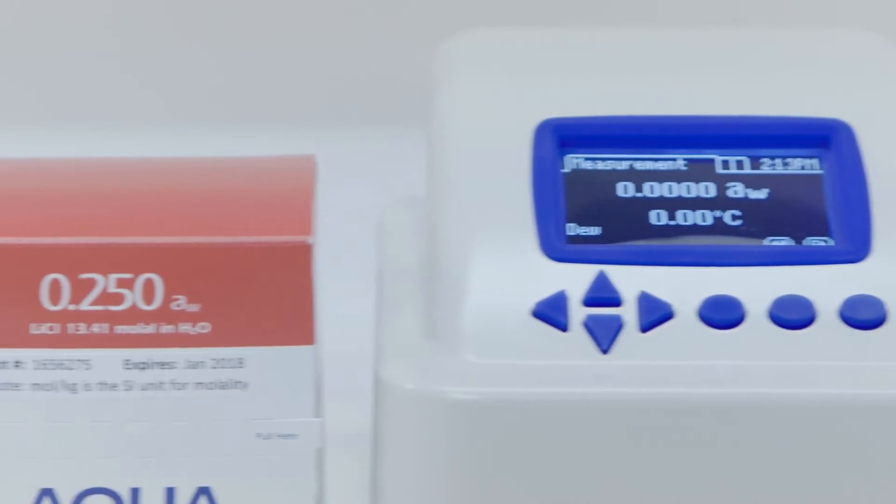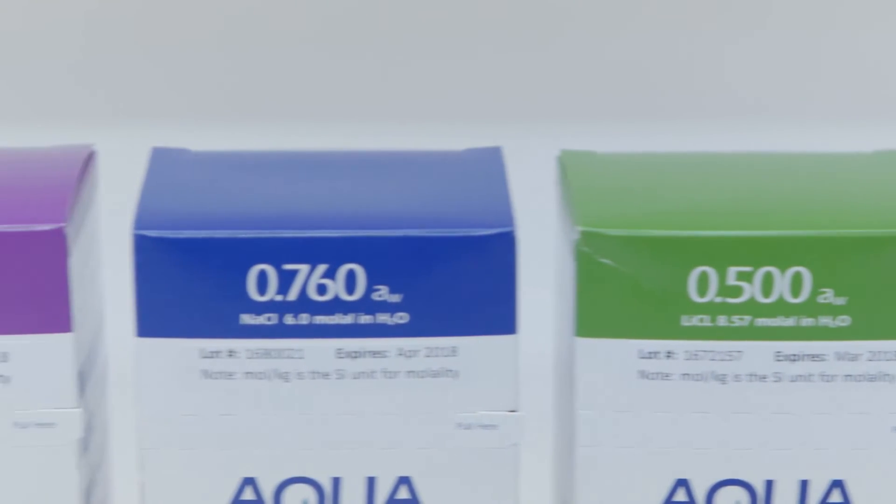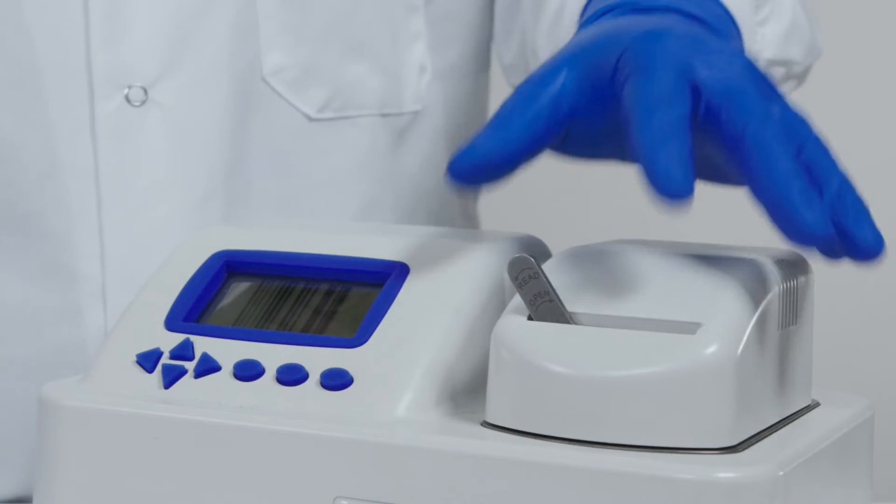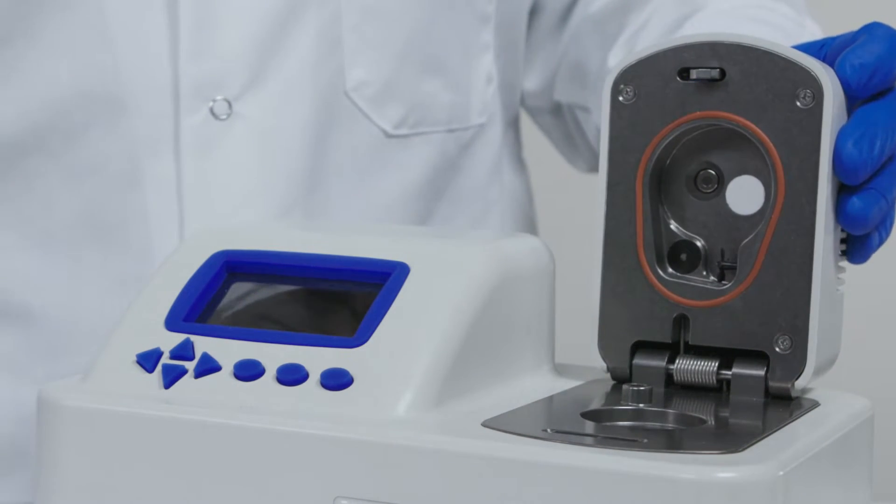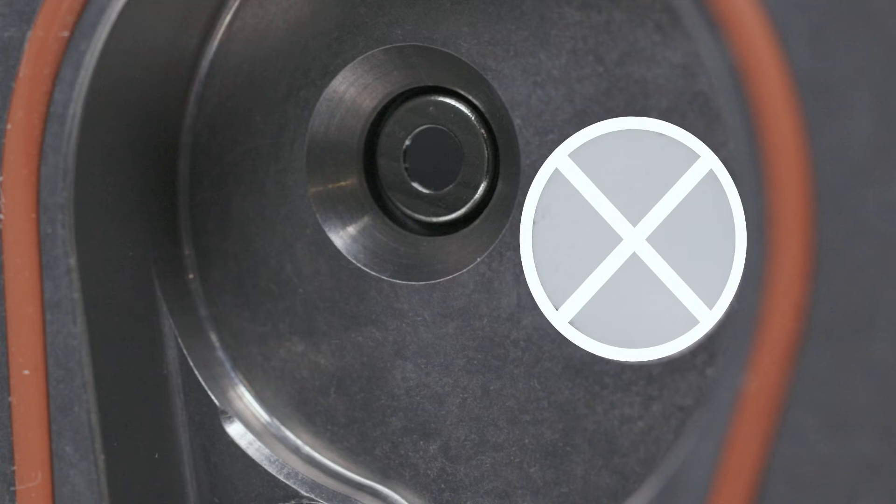Any reading within 0.003 of your solution's water activity is fine, as long as you are using the chilled mirror sensor. If you are checking the volatile sensor, any reading within 0.01 of your standard is fine.